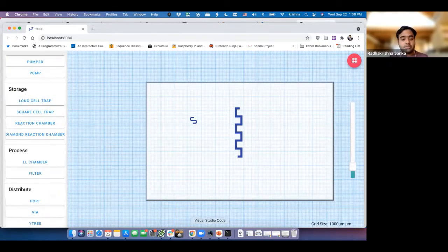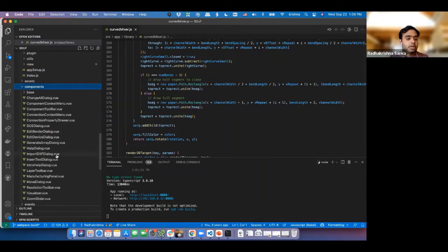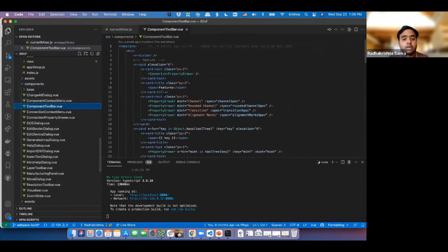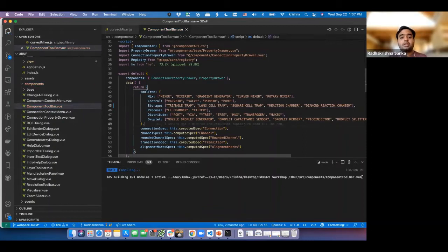So I'm going to go back to my code, go to my components folder, and we'll have a component toolbar over here. I go to the component toolbar, and I want to add a new button there. I'm going to call it triangle trap, and that's basically enough for it to say that there's going to be a new component called triangle trap, and I need to figure out how to make that happen.